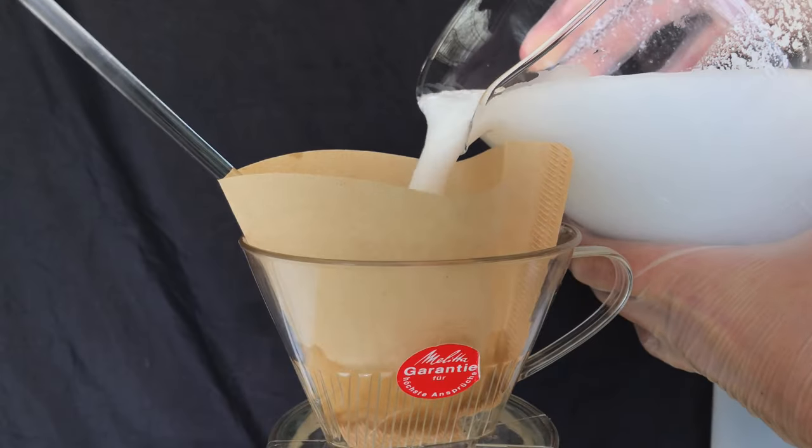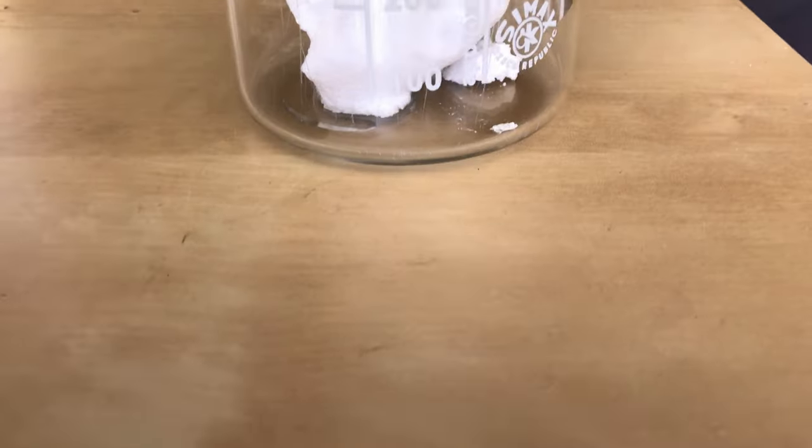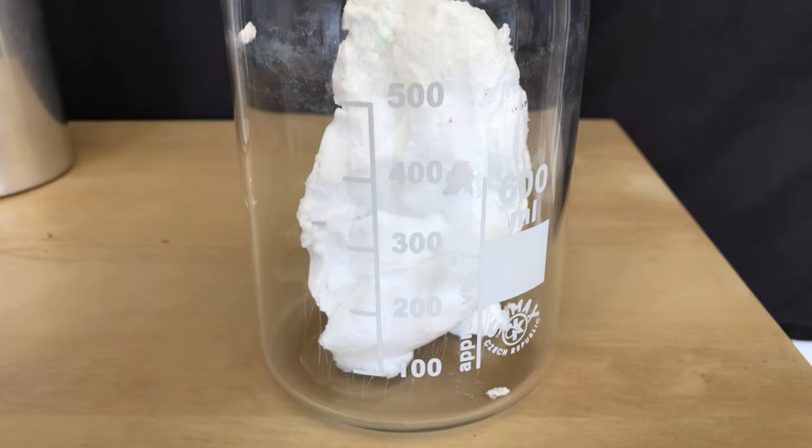To separate the water containing water soluble contaminants from the product a simple gravity filtration was performed. In the end we were left with this huge chunk of product.